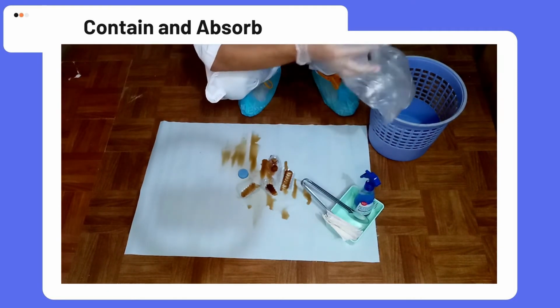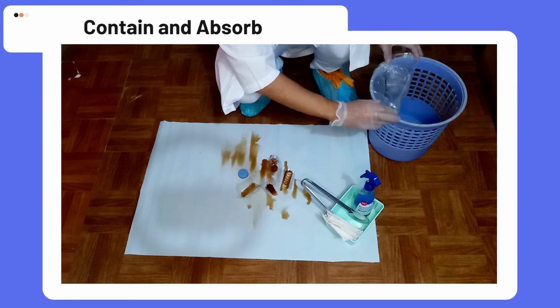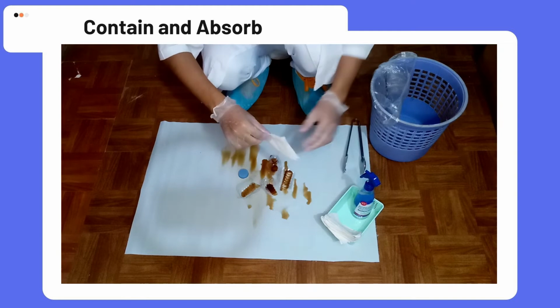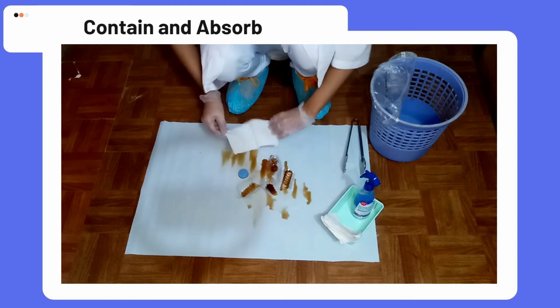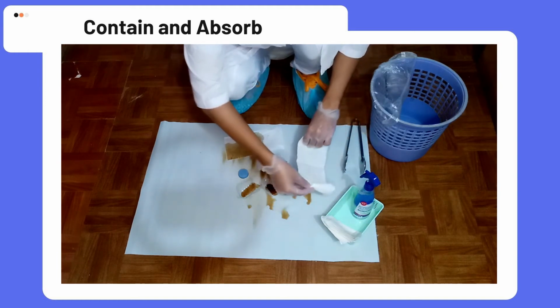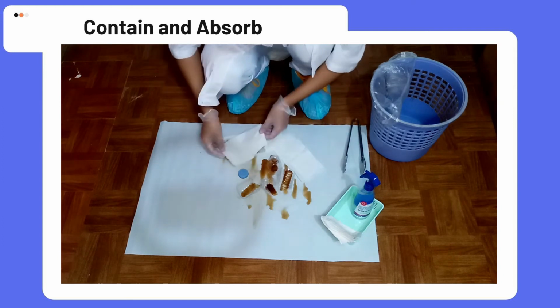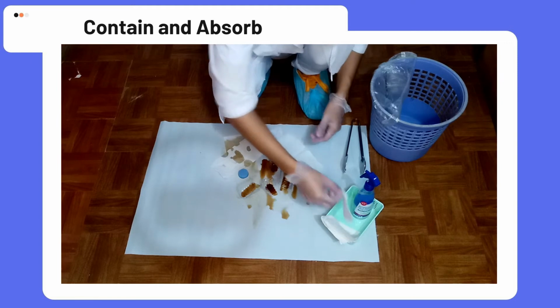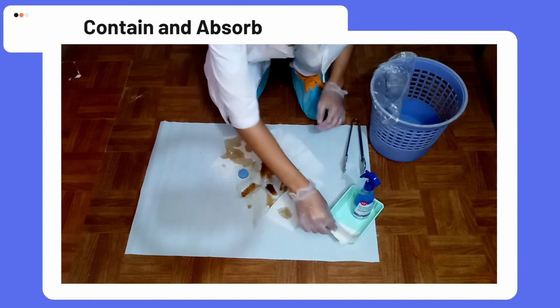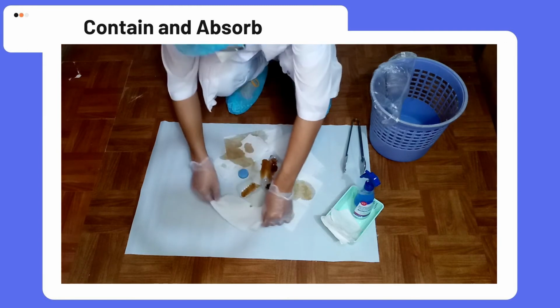First, take out the plastic bag and place it into the bucket. Get the absorbent pads and place them around the spill in order to keep it from spreading. Finally, carefully place absorbents on the remaining spill or on top to absorb the chemicals.